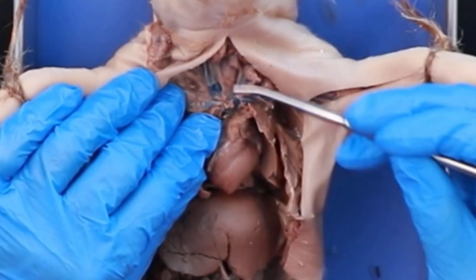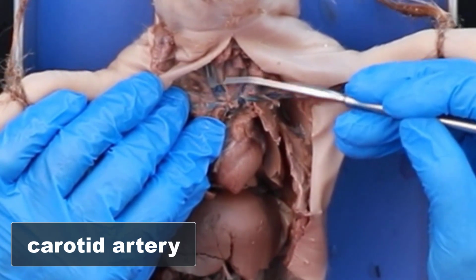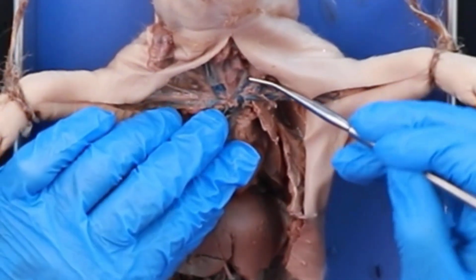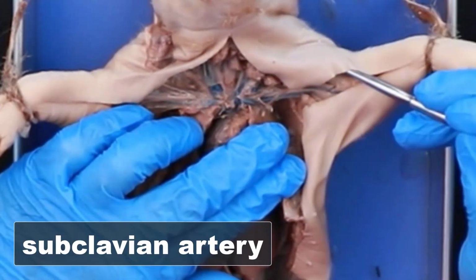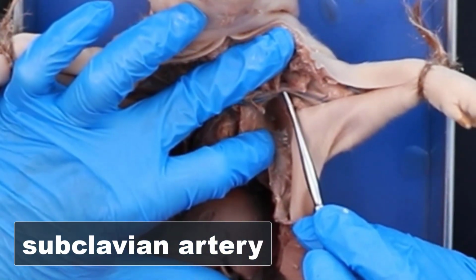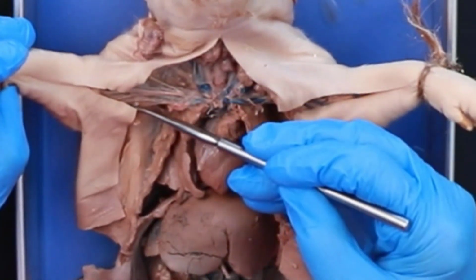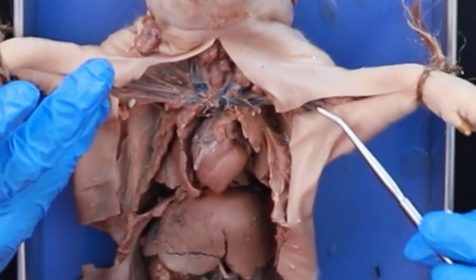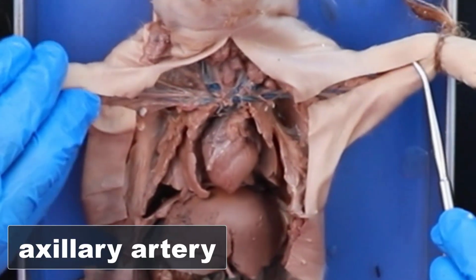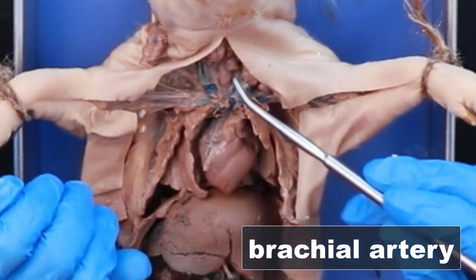And if we look very carefully here, you can see the carotid right here and right here, okay? And you can see the subclavian artery here as it comes over, and here. And then as you get into the armpit, you basically change the name of it. It's called the axillary, and then you move into the arm, and it's the brachial. So that same vessel changes names.